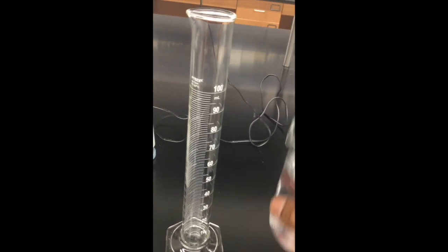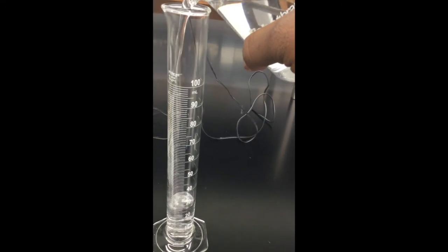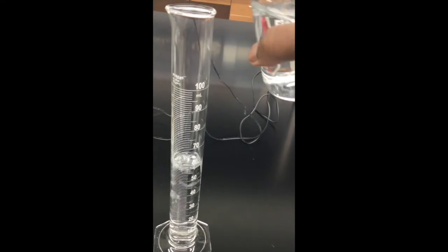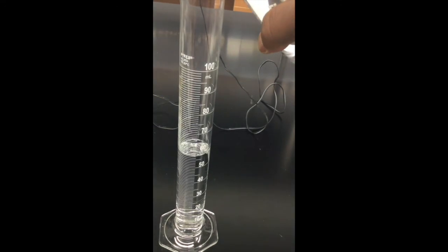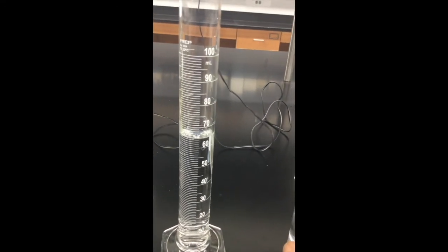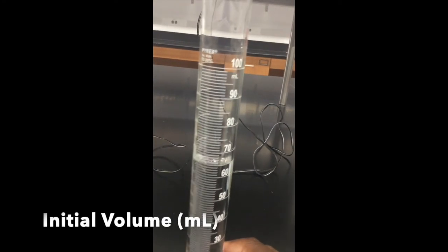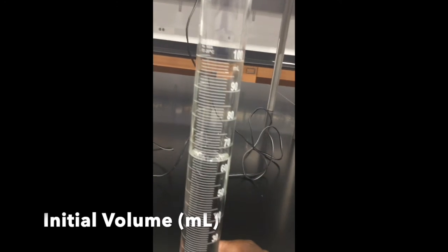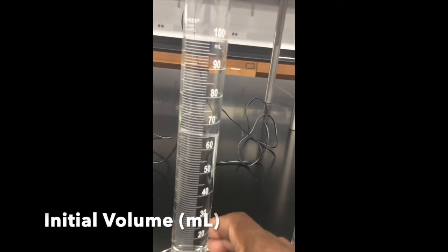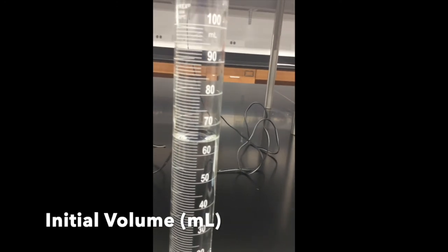All right, I'll fill the graduated cylinder with deionized water to some initial volume. It's not necessarily 60, it can be somewhere, so long as you know the initial volume. I'm just agitating so that you can see where the meniscus is.